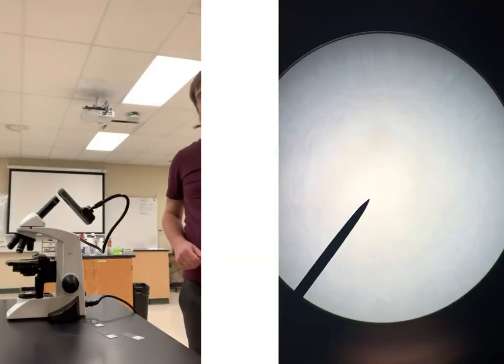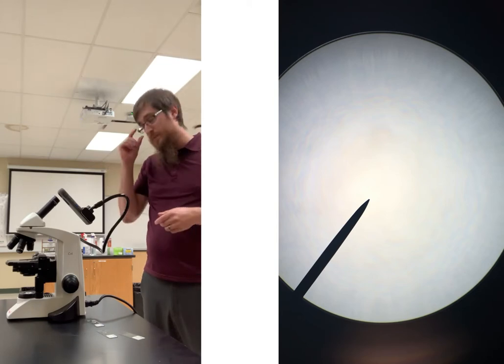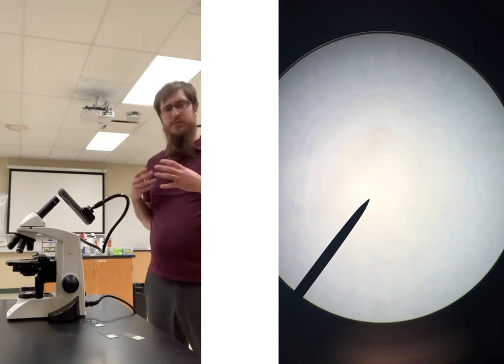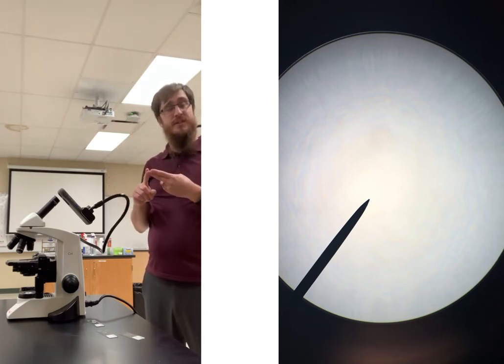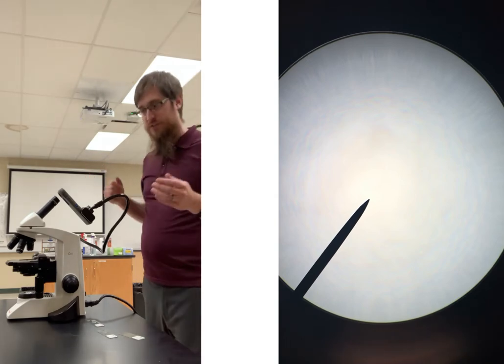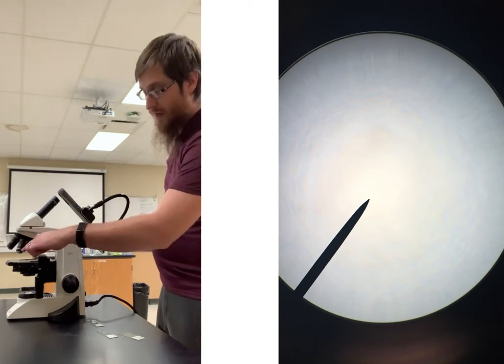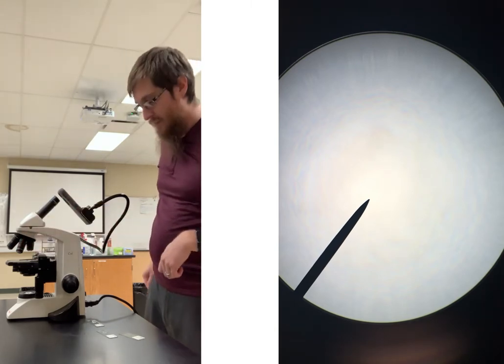Hey everybody, today we're going to be talking a bit about how to actually use the microscope. For our class, we're only going to be worried about the 4x, the 10x, and the 40x lens. We won't need to go to 100x, so we should not be using this really long lens that has the white line on it or says 100x on it.